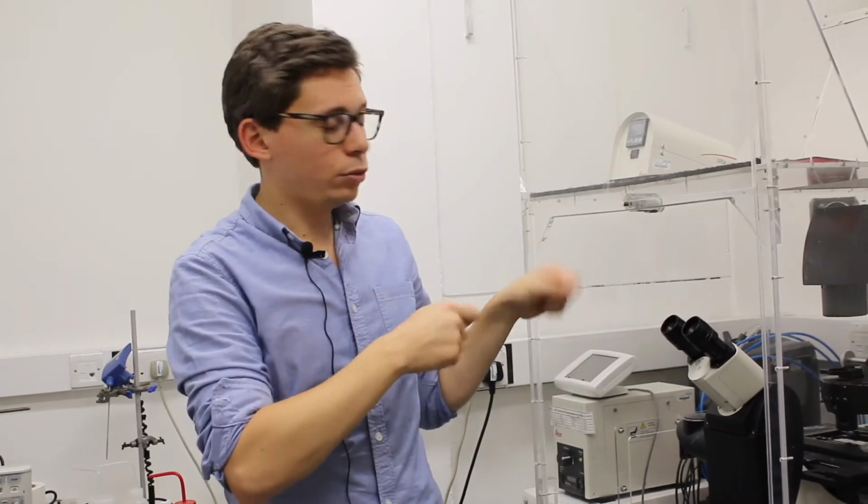So to improve this type of settings for these advanced settings, you can try and do that. So changing, centering again the condenser lens, or centering again the phase contrast filters. But if images are still not good, you can just call services and they will assist you or come and do that. So now you know all about aligning the condenser lens. Please just remember to put the two pins where they were to avoid losing them.